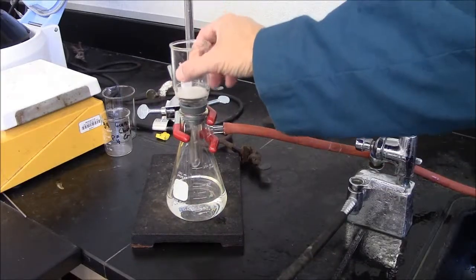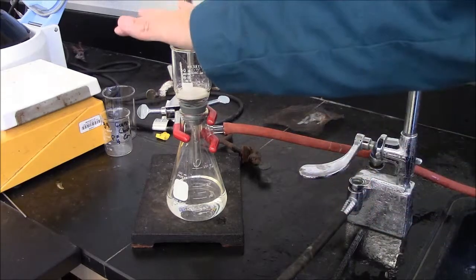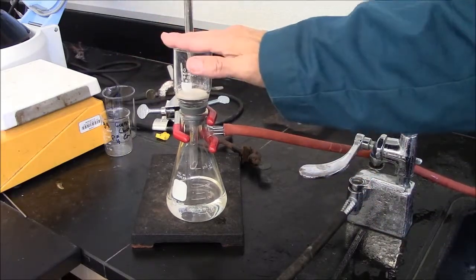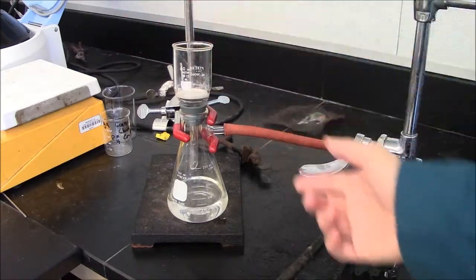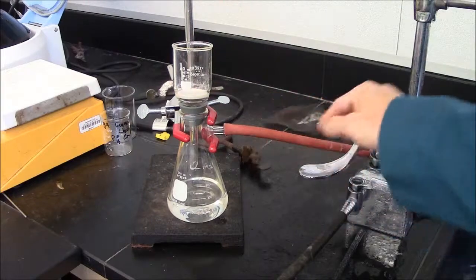It will sit on top of the vacuum flask. I may need to push down but I'm feeling a significant vacuum here on the top and that's as it should be. Air is being pulled out of the flask and is going through the frit.